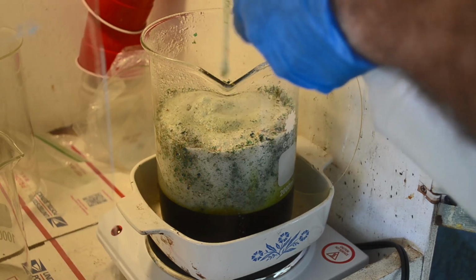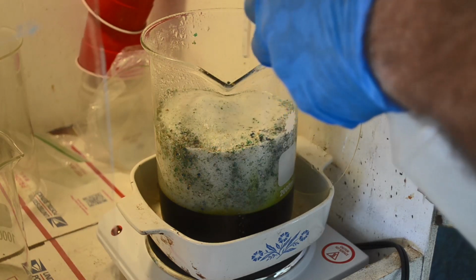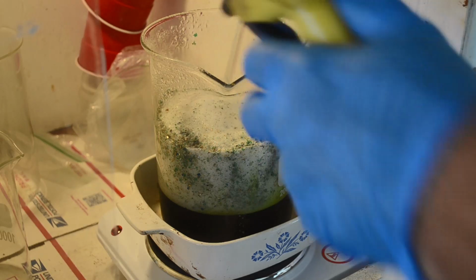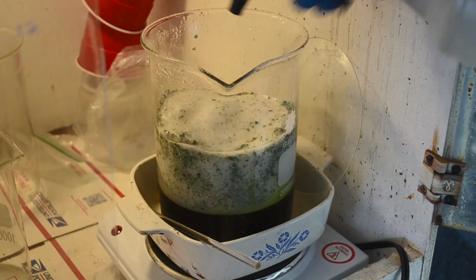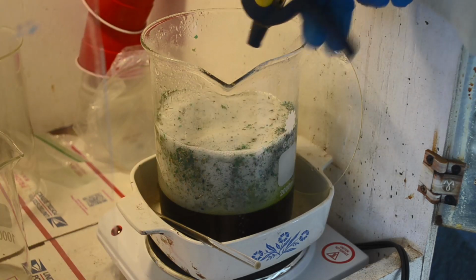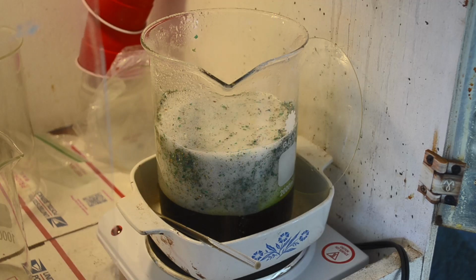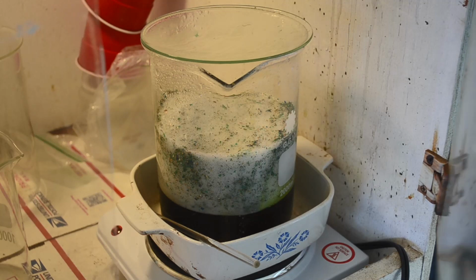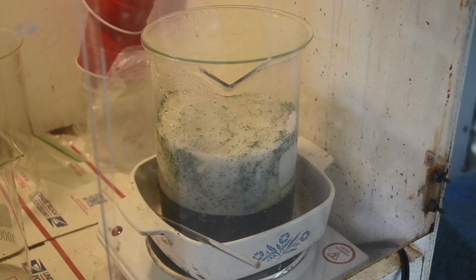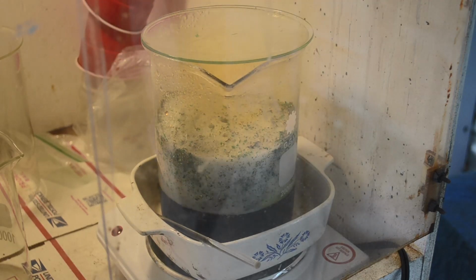Okay, I think I'm going to try and get through this reaction with this little bit of material, but obviously I'm going to have to try something else to deal with the bulk of it, because this just isn't working worth a darn. Let me see if I can just nurse this stuff through the reaction. Get all those foils dissolved, or at least the bulk of them.